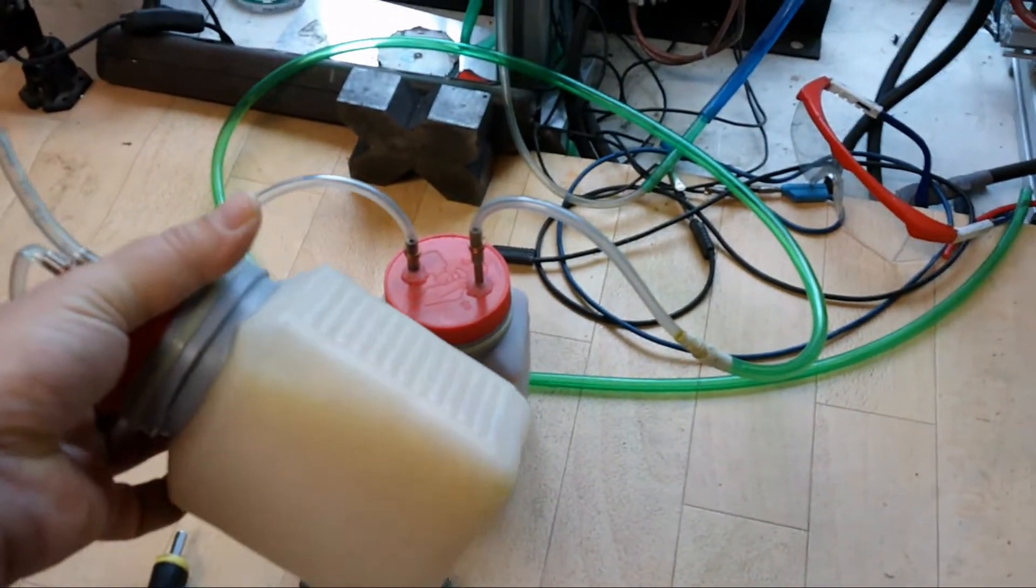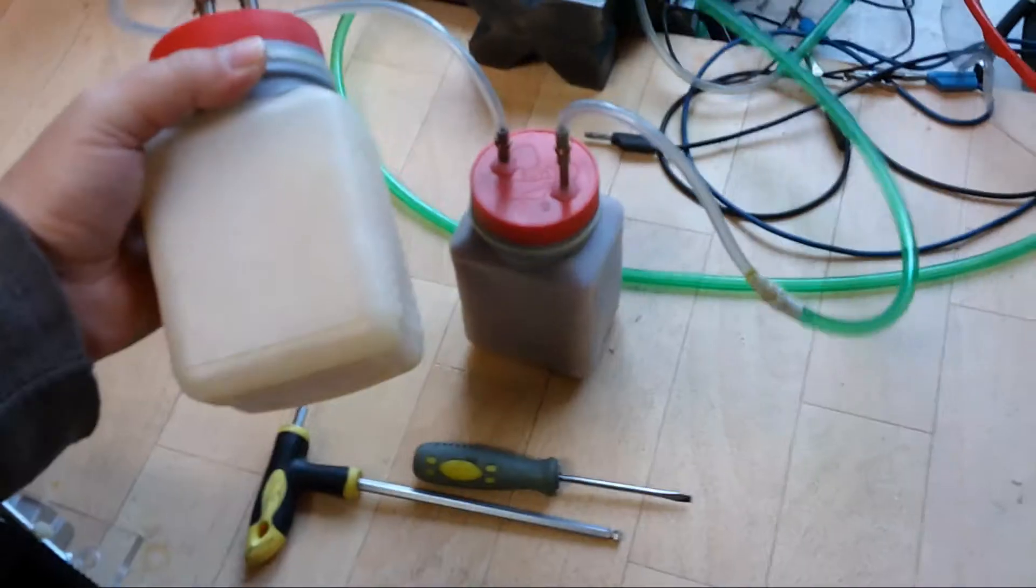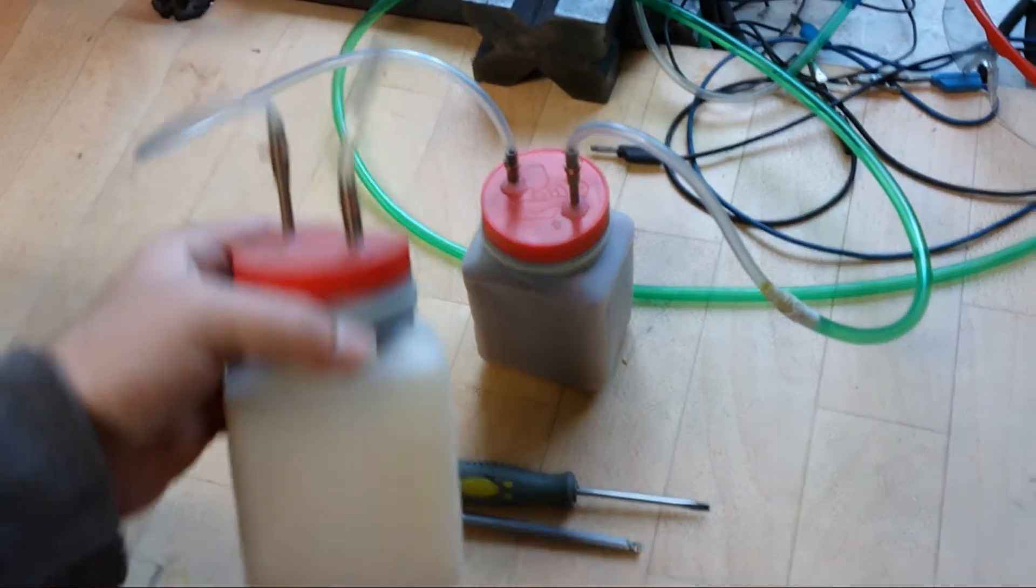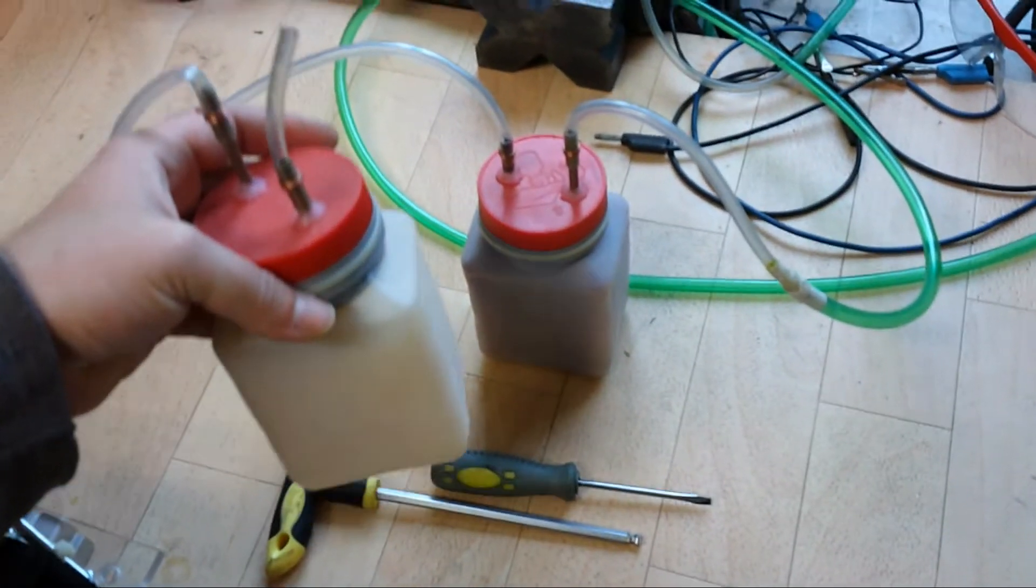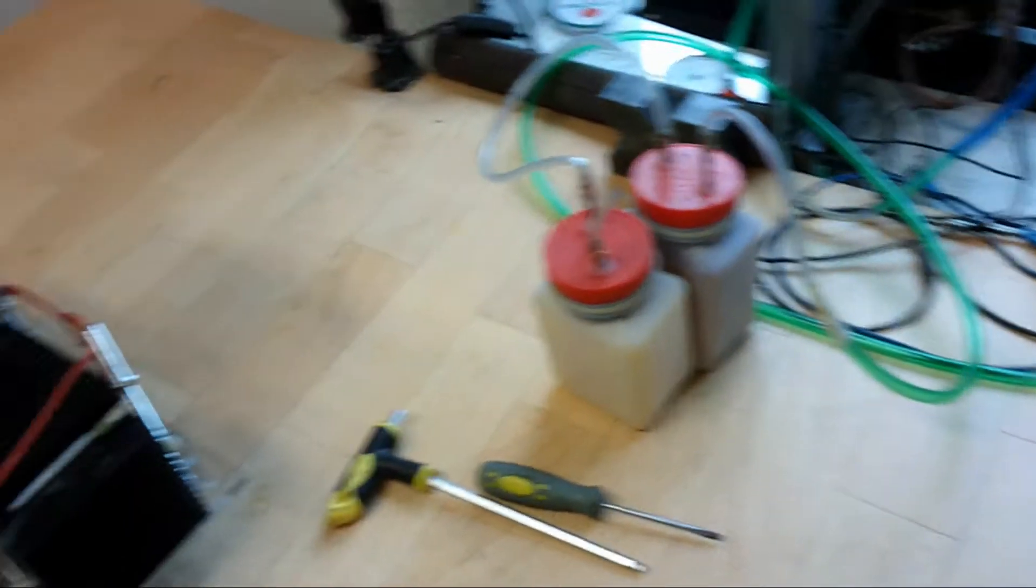What we can see here, that's the air drying system. Very primitive as you can see. It is just silica gel inside. But as I told, I don't think that I will need that, so I will leave that back.